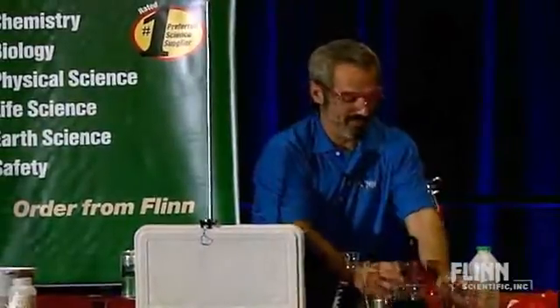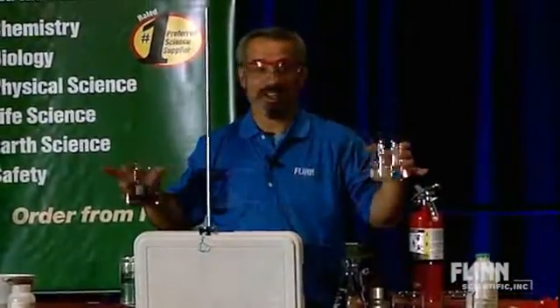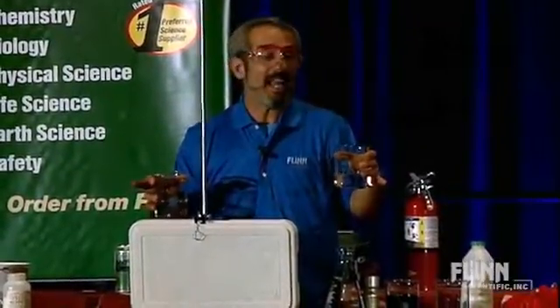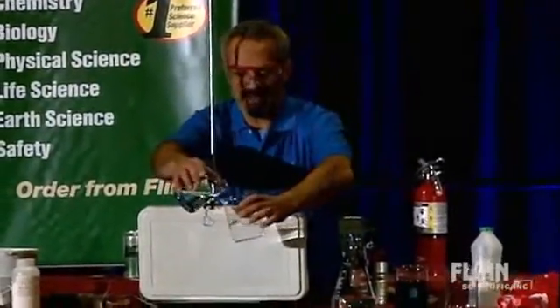And this time I'm going to keep pouring. You guys know this — when you show this to a general audience, it's like this is the most amazing thing ever. And to be honest, it is. But it's the iodine clock reaction, and I'm just a big fan of this one.